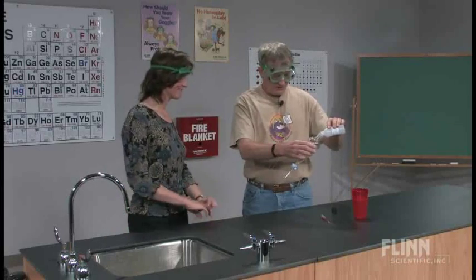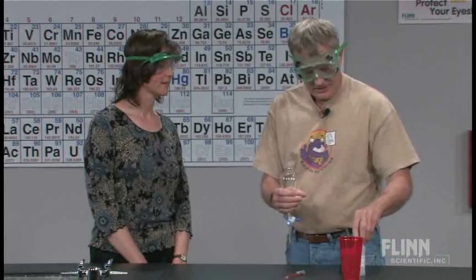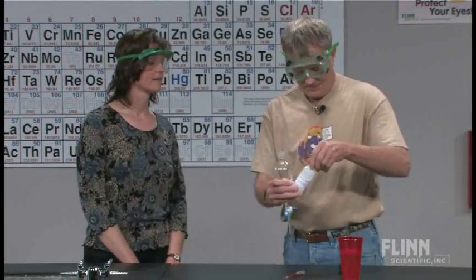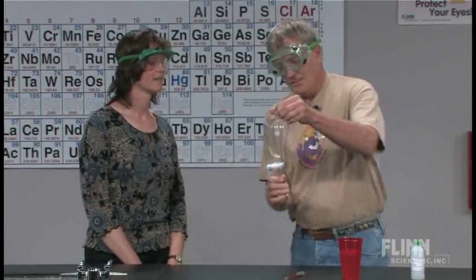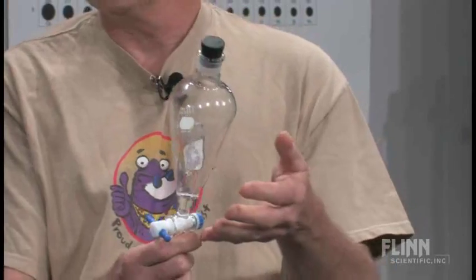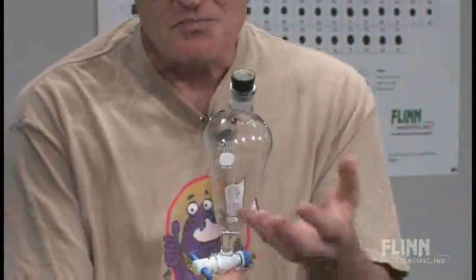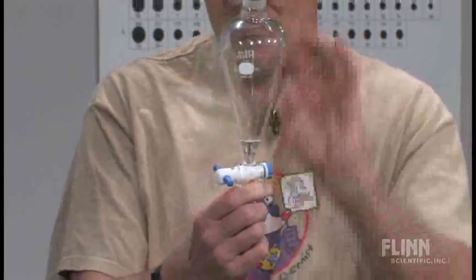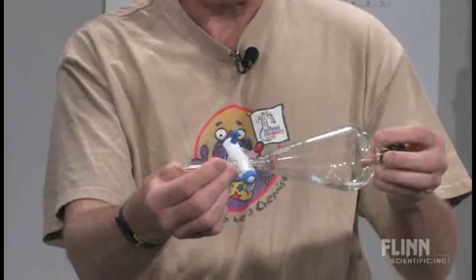All right, so I'm going to let a little of this run down in here. I put in some, and I'll close it up and put the stopper on. Now, it's a volatile liquid. Inside here right now, it's evaporating. There's more gas molecules in here because of the evaporation of the liquid. I'm going to swirl it around a little bit.